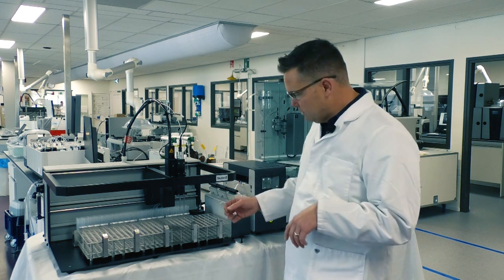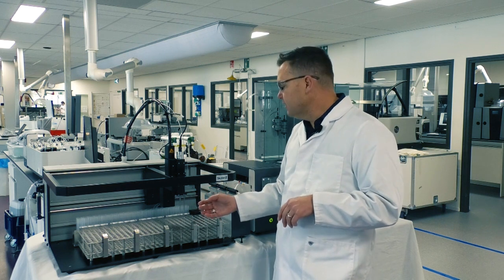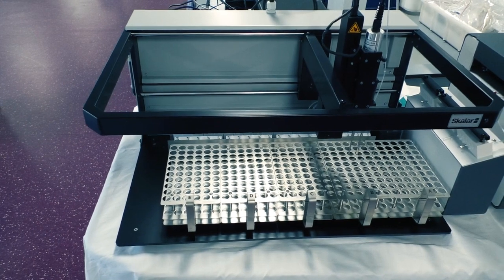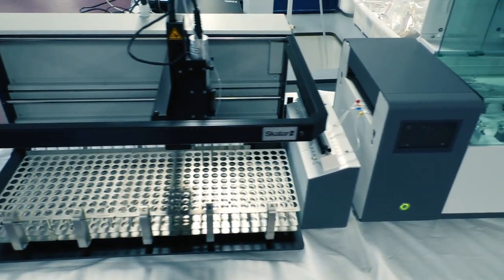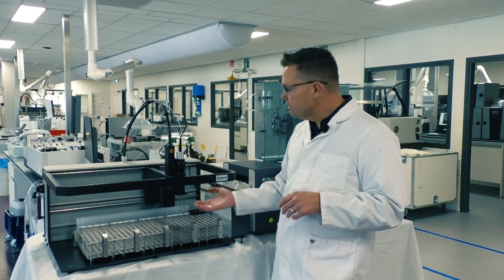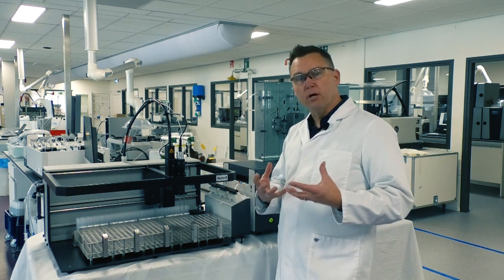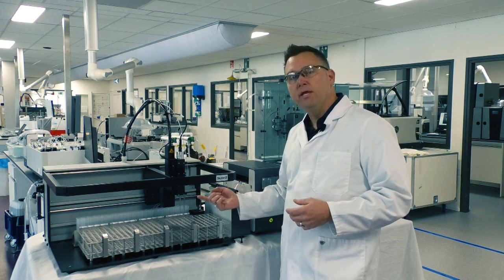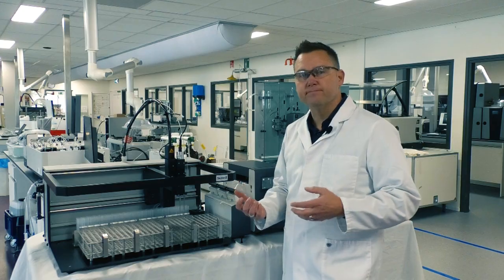So what we see on the auto samplers, I have two very important pieces of our auto sampling process. We have a mechanical stir that basically agitates that sample so that those larger particles don't settle out. Secondarily, we also can add the homogenizer to it, which is basically a sonicator. So we all know what a sonicator is, and we take those larger particles and break them up so that way they can actually be aspirated via the needle and over into the digestion step of the analyzer.